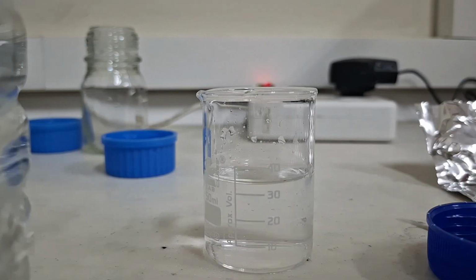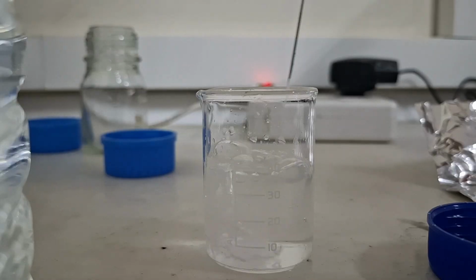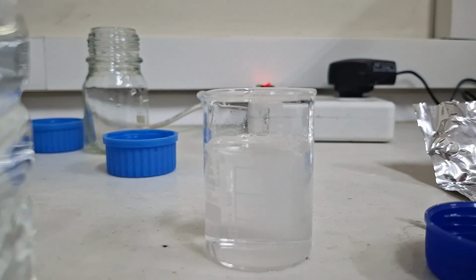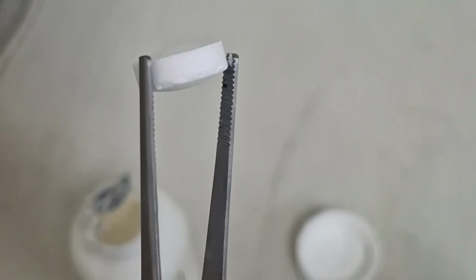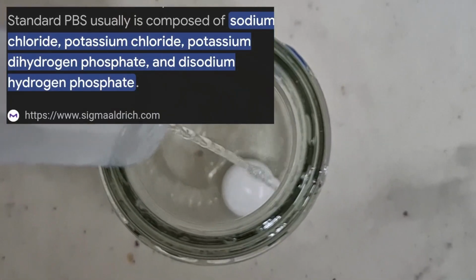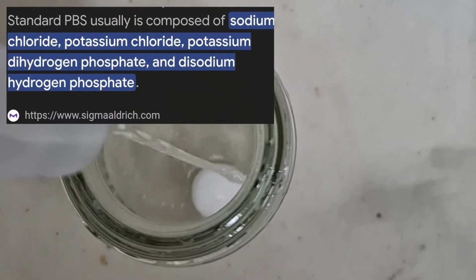The proper way to do this is to use a separate container for each sample. It could be dishes or anything else. Add the same fixed volume of PBS to all containers and then place each sample into its own container. From this moment, which we call day 0, the degradation process of your scaffolds begins.